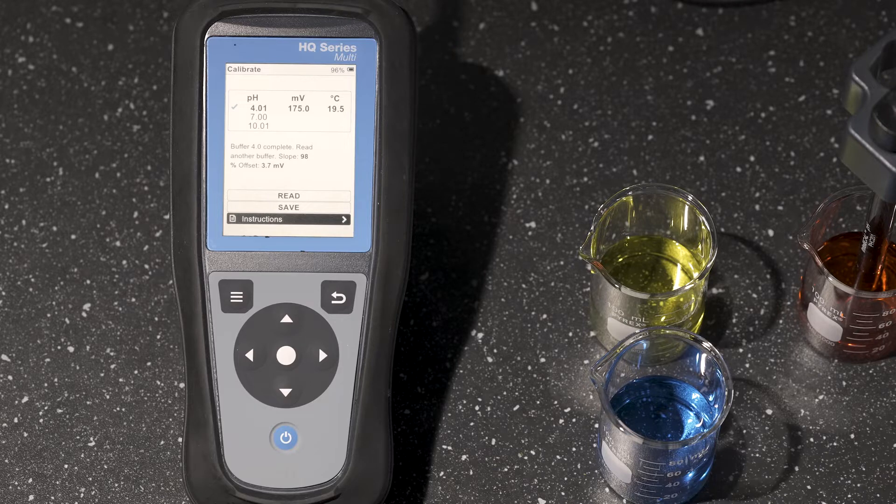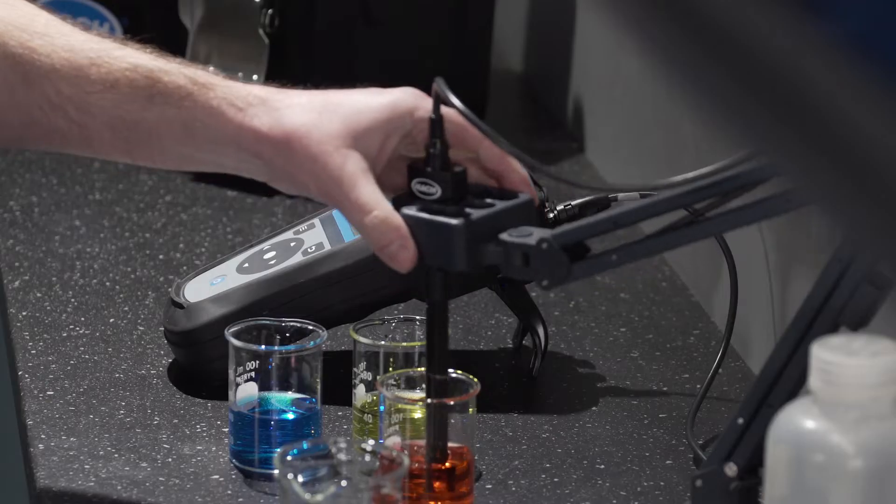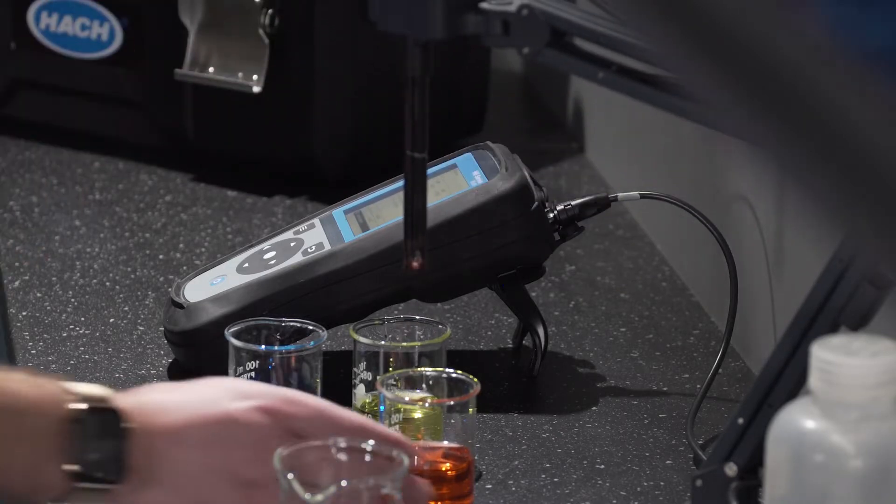We've locked in on buffer 4.0. Now's my chance to read another buffer or go ahead and save. I am going to go ahead and do a three-point here.